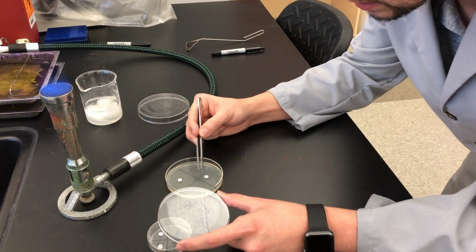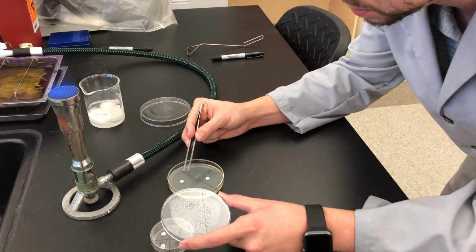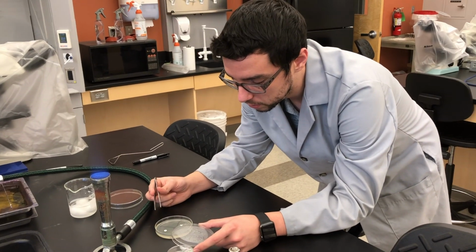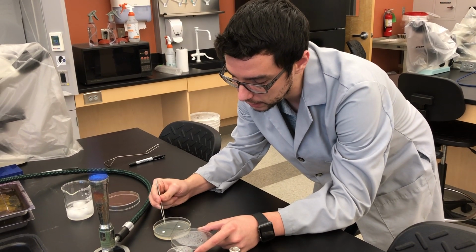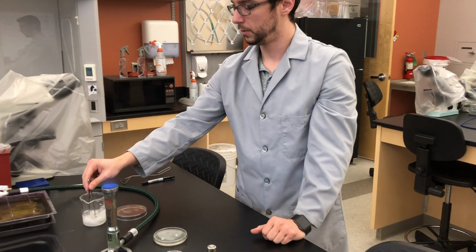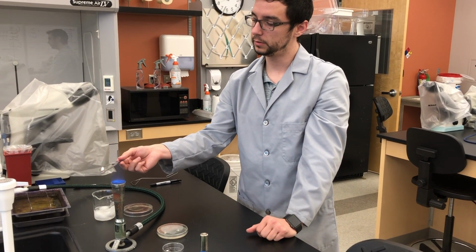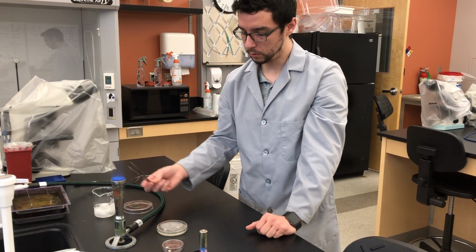So I'm adjusting to make sure that my penicillin is not too close to the wall. You want to give them space to spread out, okay? So use your lines as general indicators, but make sure that your 4 discs are relatively evenly distributed across, okay? Flame sterilize. And again, be careful, don't burn yourself or drop flaming alcohol on anyone. Let this cool.